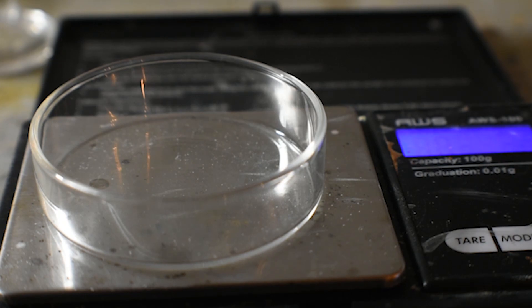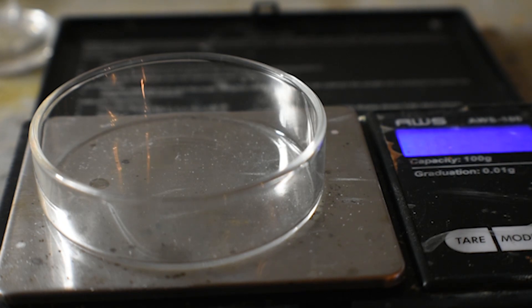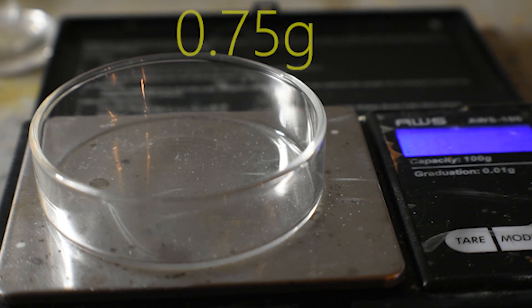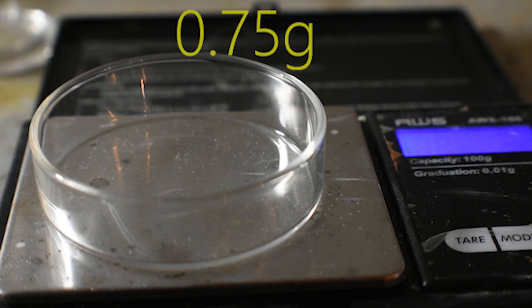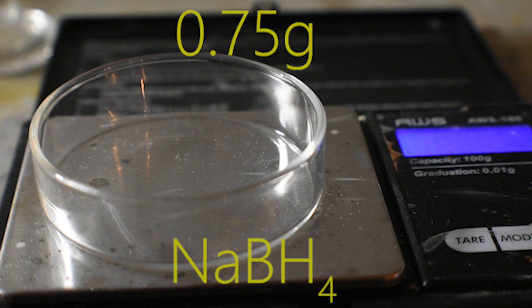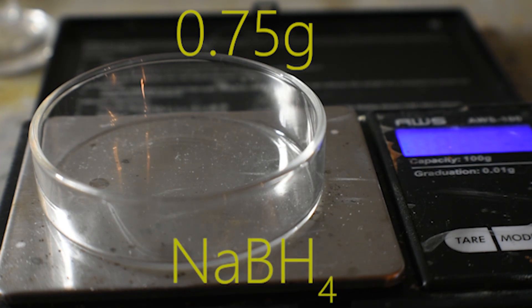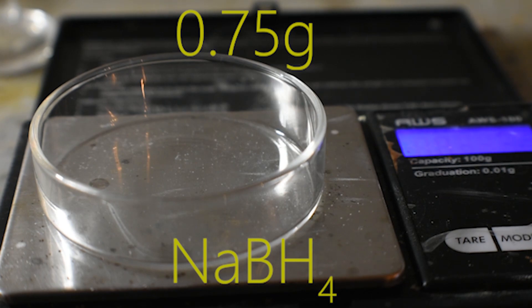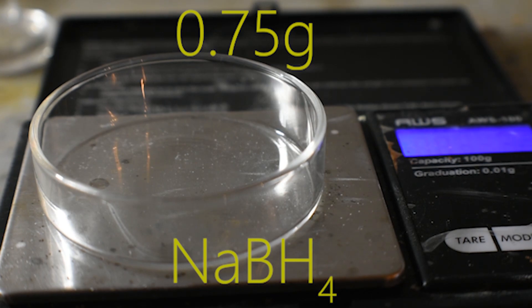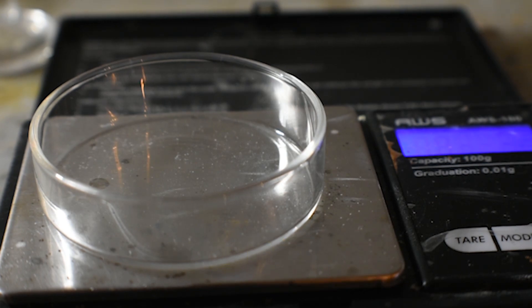Next, for the reducing agent, I'm going to need 0.75 grams of sodium borohydride. First, I have to weigh it out, and before I weigh it out, I have to get it out of the fridge.